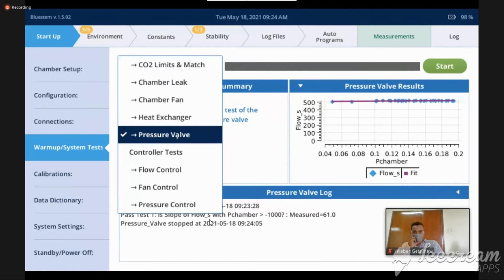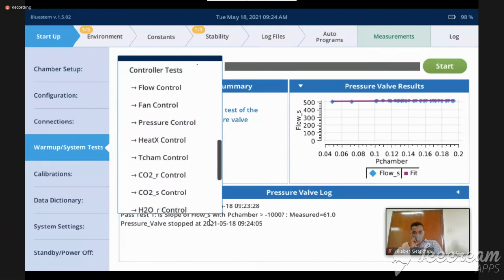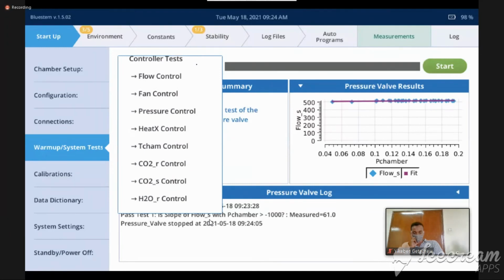Before we talk about some of the things that we would see if we ran the warm-up tests all together by pressing the overall start button rather than looking at them individually, we do have a couple of other categories of tests down here. The controller tests are exactly what they sound like. We go through a lot of different control options for flow, for fan, for the heat exchanger, for temperature control, CO2R, CO2S.